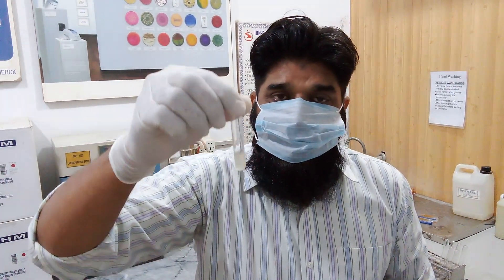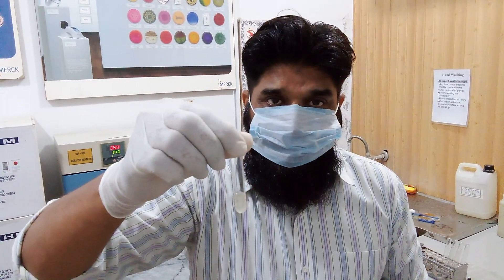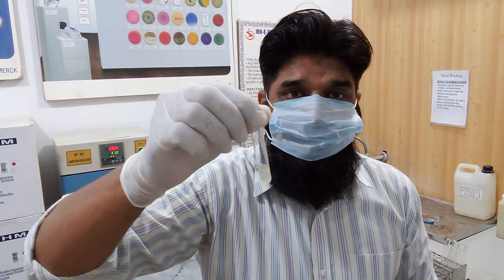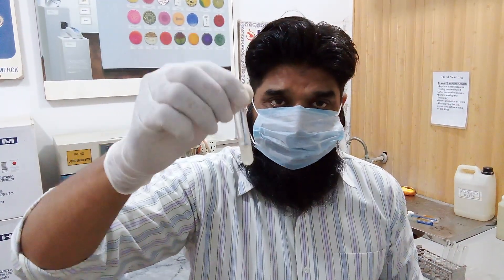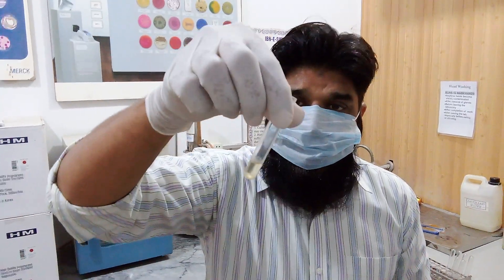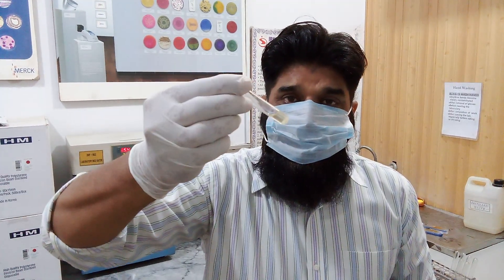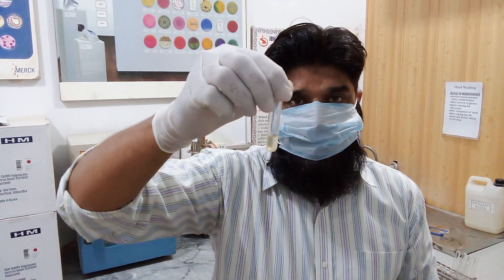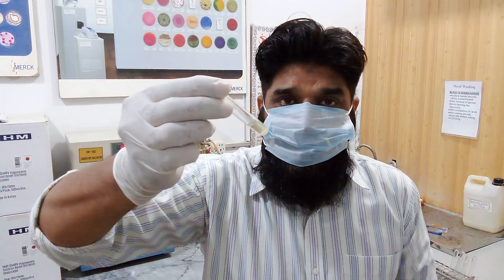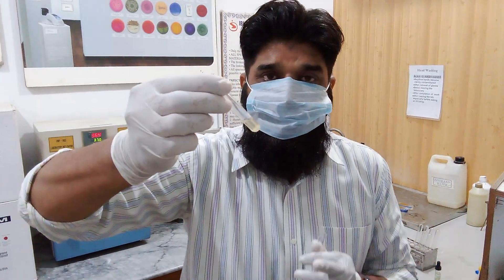When the coagulase test is positive, it means the unknown gram-positive organism is Staphylococcus aureus. If coagulase test is negative, it means Staphylococcus epidermidis or Staphylococcus saprophyticus is present — there is no Staphylococcus aureus.